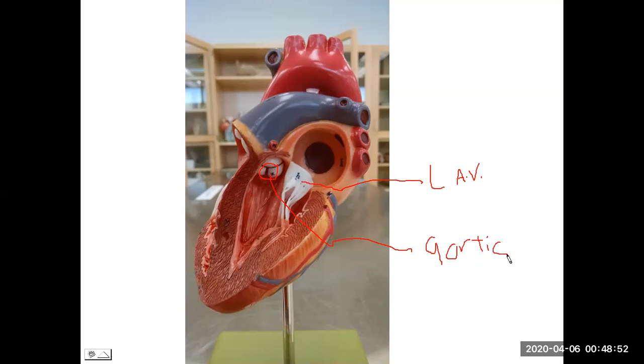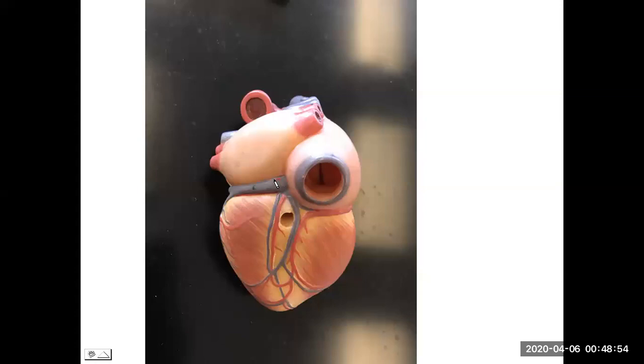We'll then go to the posterior view, and this large vein we see here. This is the coronary sinus on the posterior side of the heart.